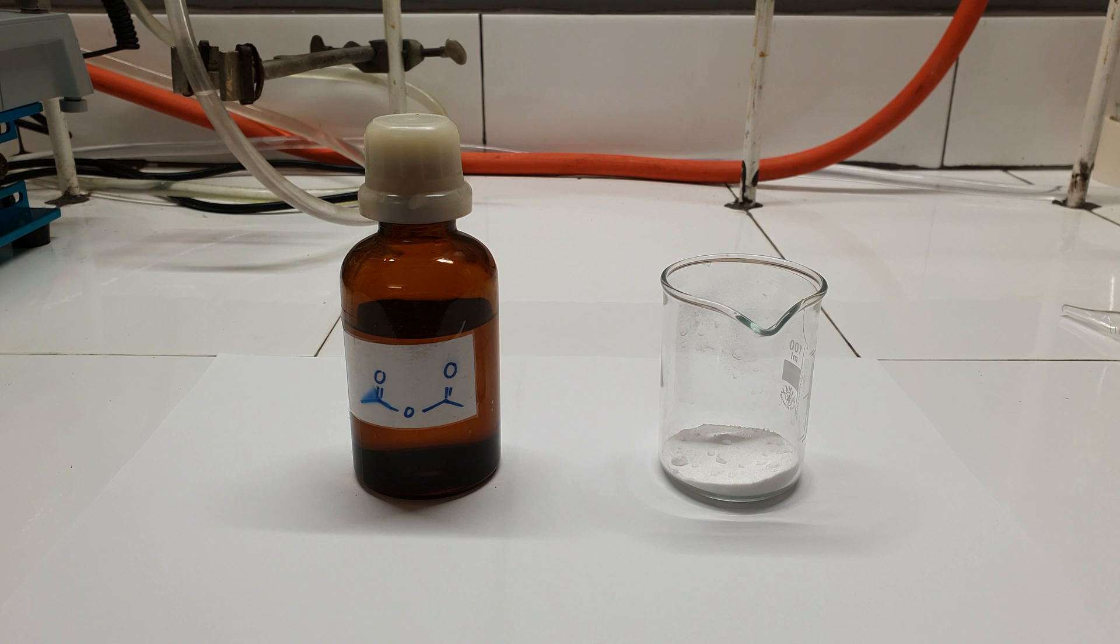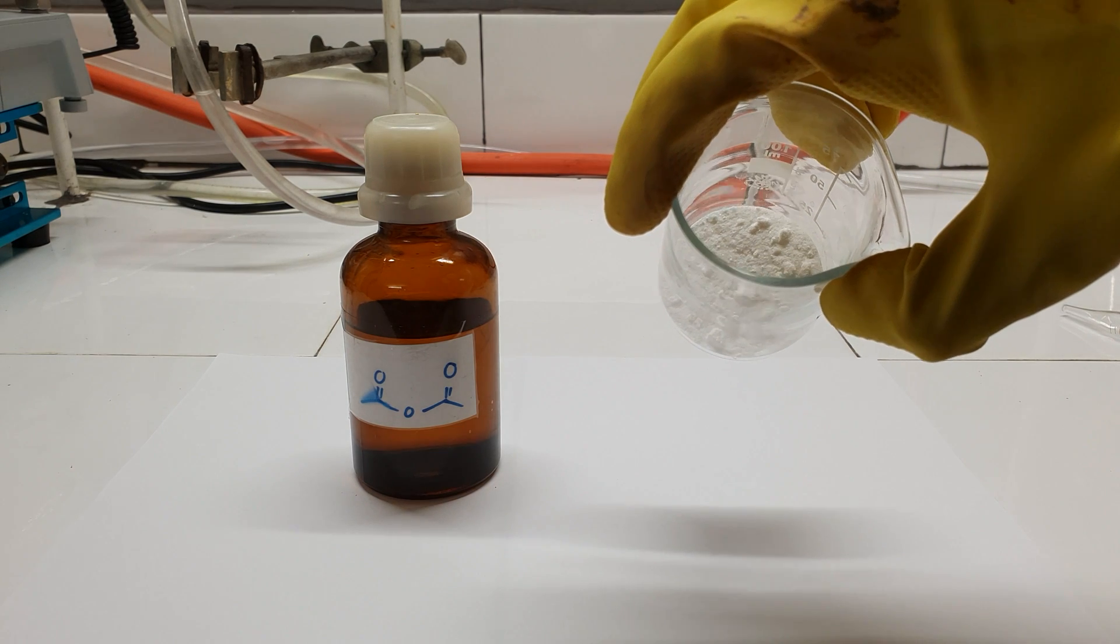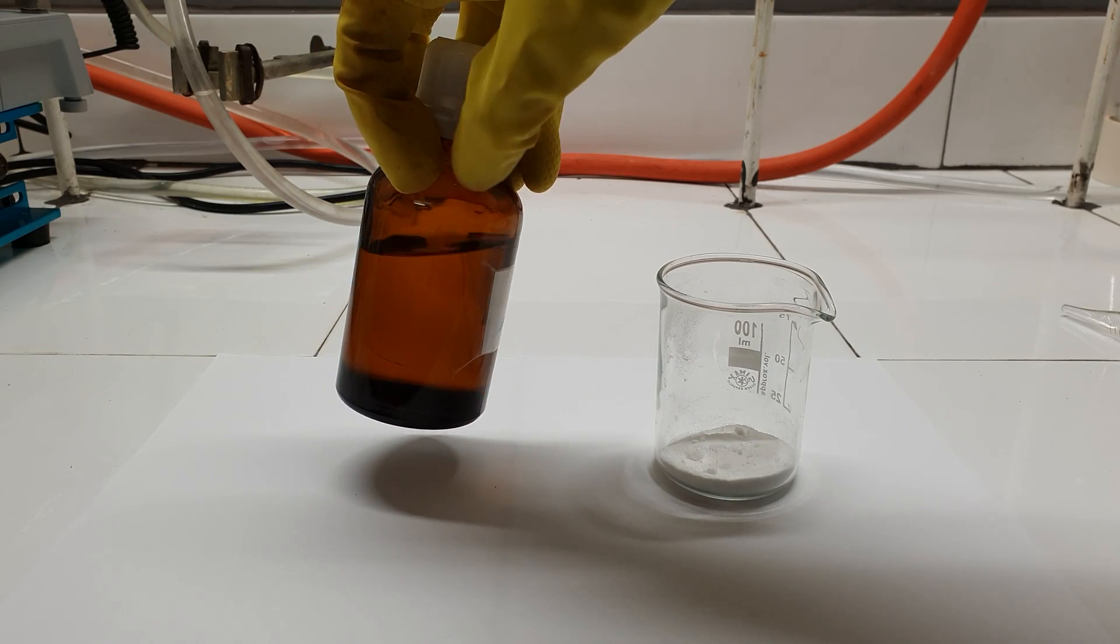So these are the two main ingredients I'm going to be using for this reaction. On the right, we have the salicylic acid and on the left is the acetic anhydride.